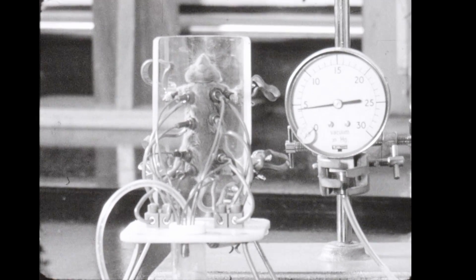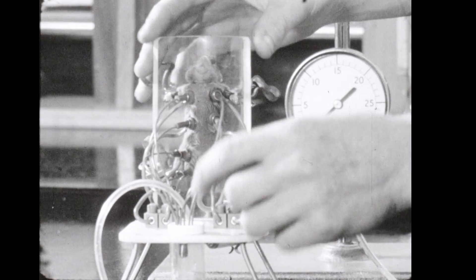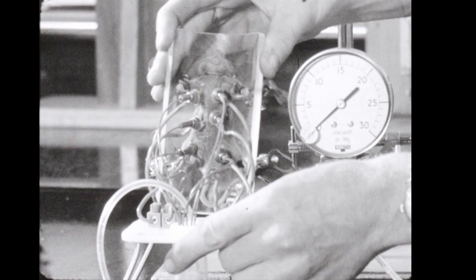Pulsation is not necessary for milking mice. A small amount of air leaks into the teat cup allowing easier and cleaner milking out.